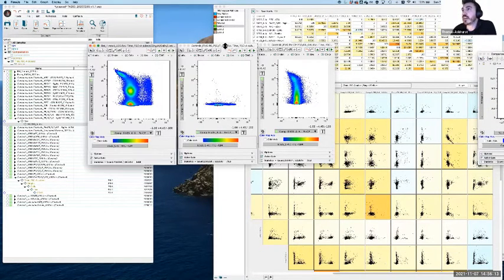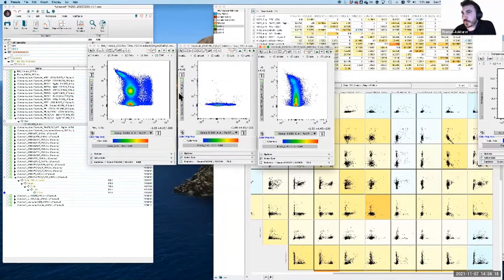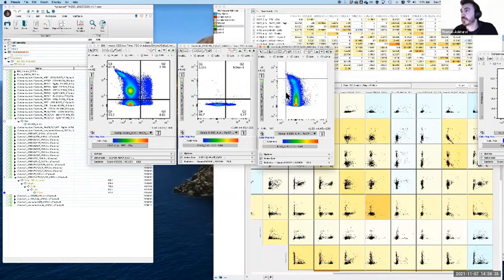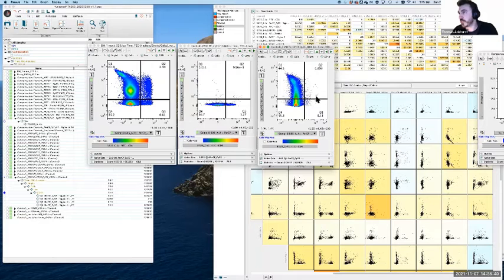So what we can make an assessment of here is that if we roughly take some measurements, there are cells that are going to be single positive or double negative. I'm not drawing these gates to be super accurate. I'm just doing it as a visual guide, for the purposes of the workshop. Now, I do realize that this is actually a control which we screwed up at the time, which is why it's not quite as bright. But what you can hopefully see, and you'll see in the other examples, is that this is getting brighter and then leaning over to the left, albeit not quite as high.